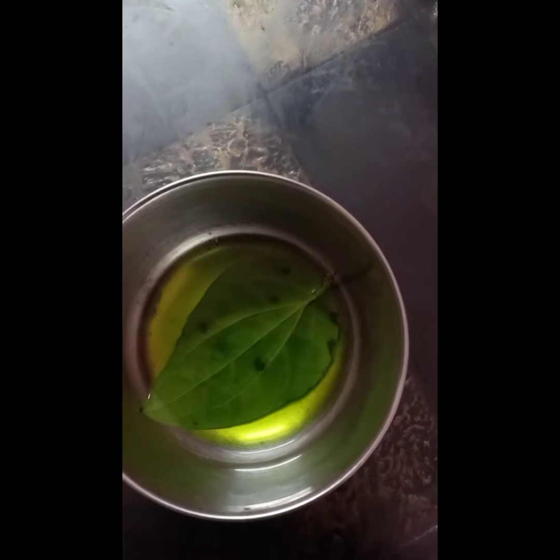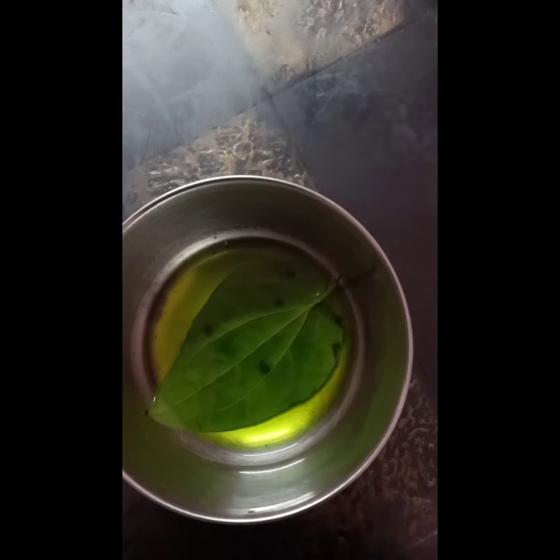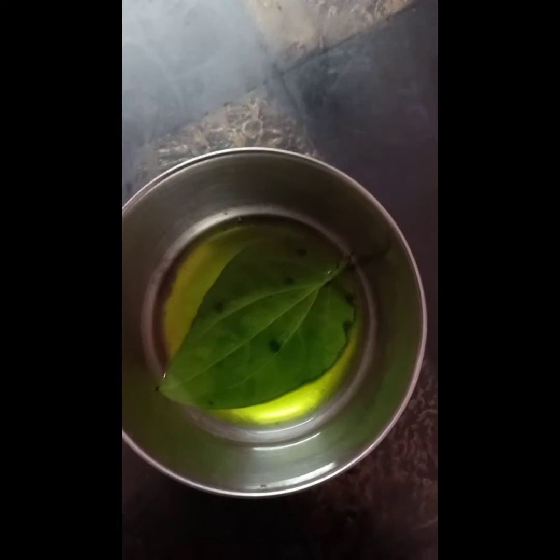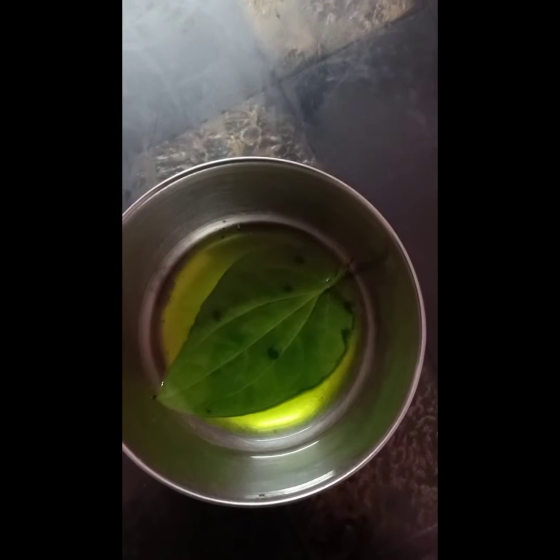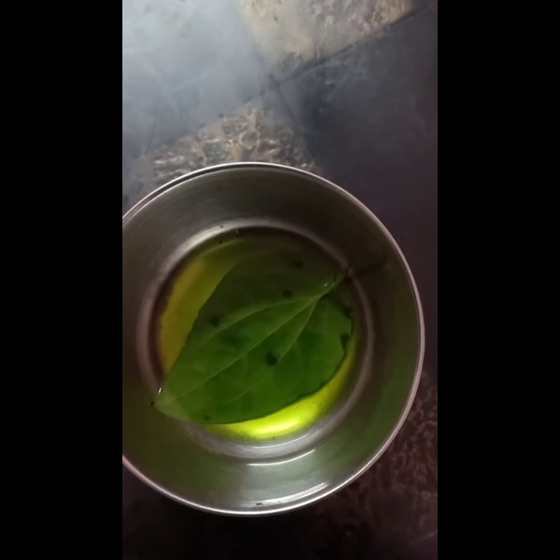This is a test to show the presence of starch in the leaf. To do this, first the chlorophyll pigment should be removed from the leaf. This is done by adding alcohol, or if you don't have alcohol, you can use some amount of sanitizer and dip it for 5 to 10 minutes.